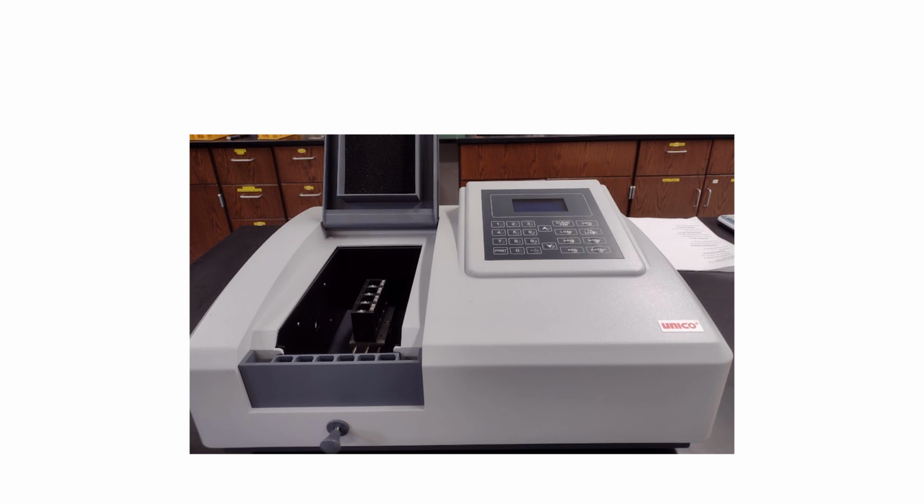So this is a spectrophotometer. What this machine does is you can put samples in these little spots right here, and I have a close-up of that in just a moment. And as you can see, we've got a screen here where we'll show numbers of the readings. What we are doing is we are putting a sample in here. There's a light source in here. There's going to be a light that's going to shine through the sample, and it's going to measure the amount of light that makes it all the way through the sample and out the other side, essentially.